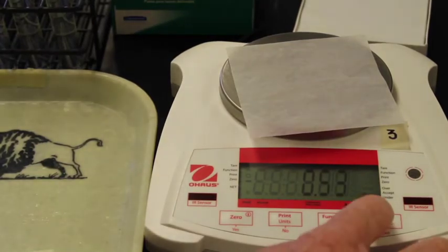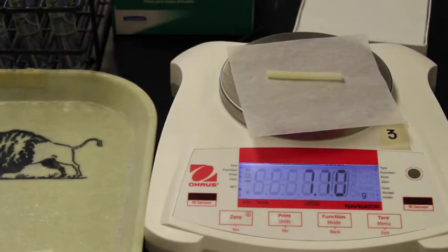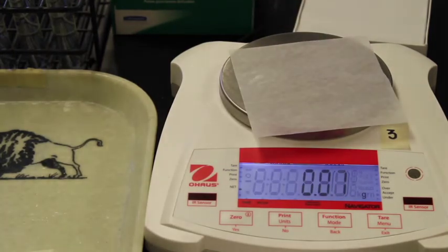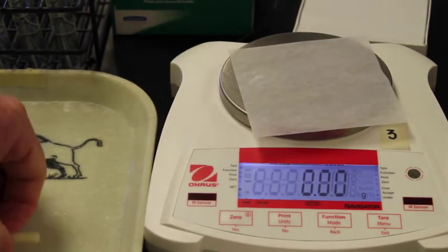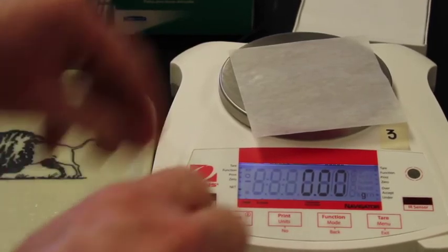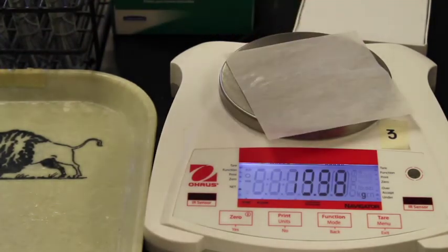Okay, I'm going to tare it. I will now weigh it. You can actually get the weight yourself and record that in your manual. This is the 0 molar. I'll place it in the 0 molar. I'm going to blot and then put this on here. Let it sit. You can mass that one and record that one in your lab manual.